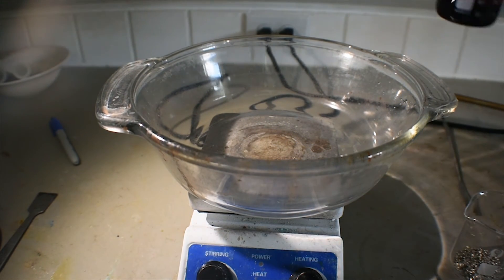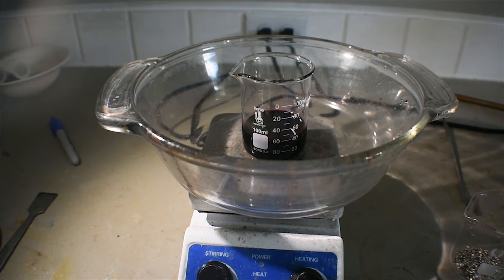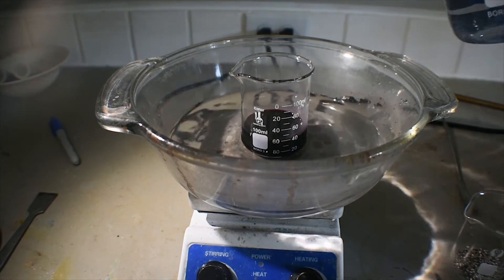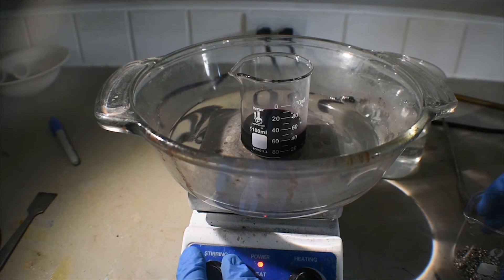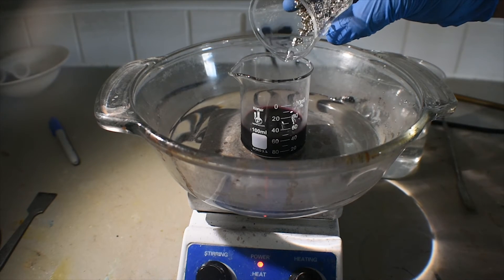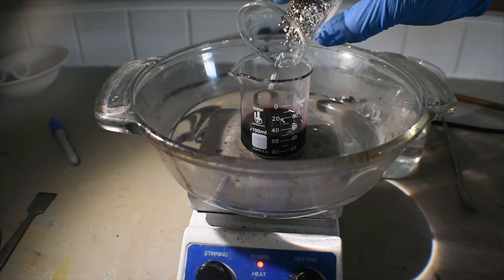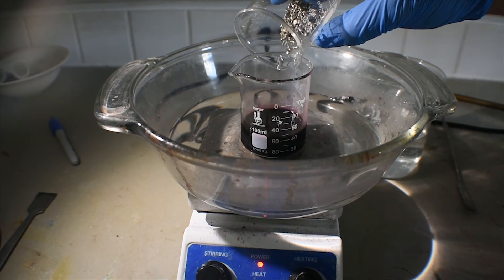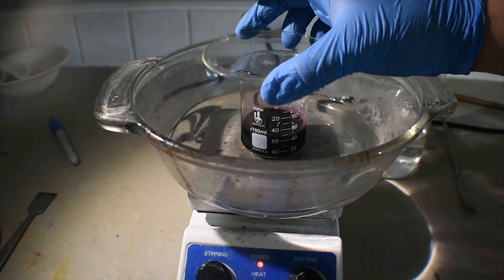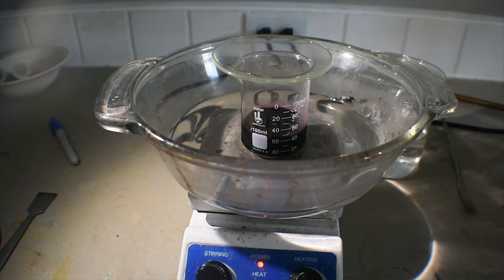Make sure this fits nicely. I'm going to add the warm water up to about the 20 ml mark on the outside of the beaker. I'll turn stirring back on. I'm probably going to add about half of this tin. I'm going to cover the top of the beaker and just let it stir and react. The stir bar is knocking against the tin that's in there. We're going to let this react and watch the color change.